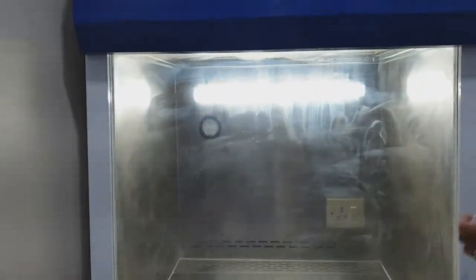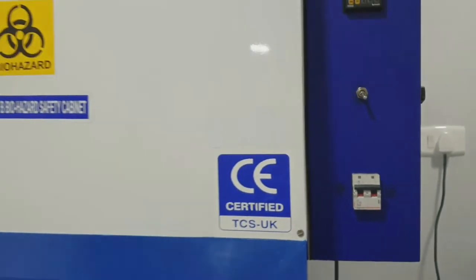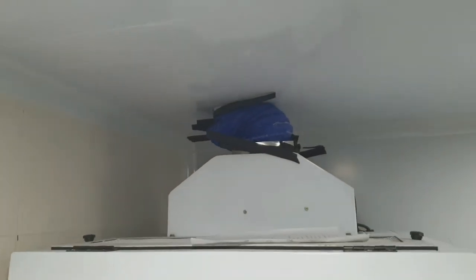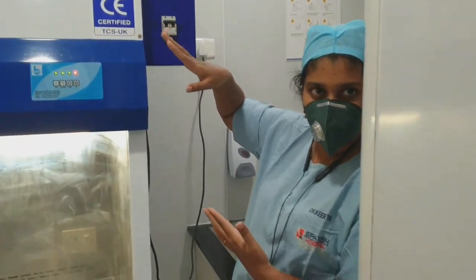I will explain about the inlet of air — how is all this air suctioning happening? If you see there, there is an outlet provided where the air is exhausted into the environment. But it is clean air which is getting exhausted; we are not causing any harm to the environment.